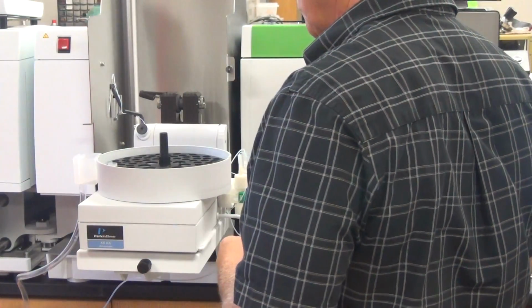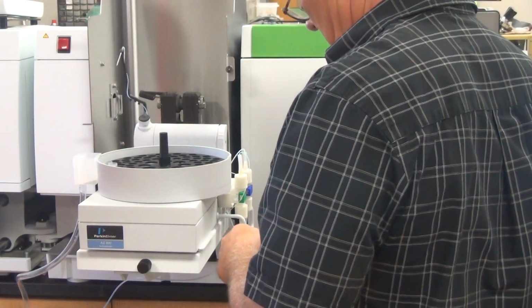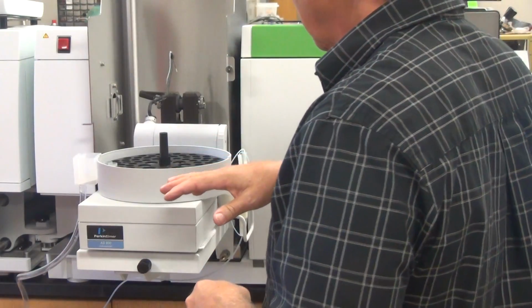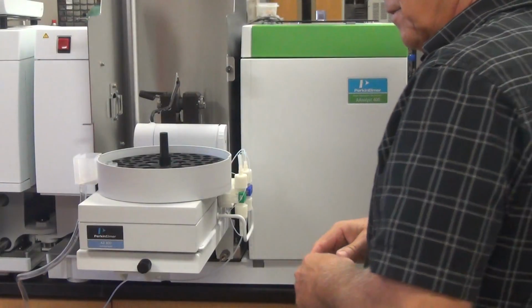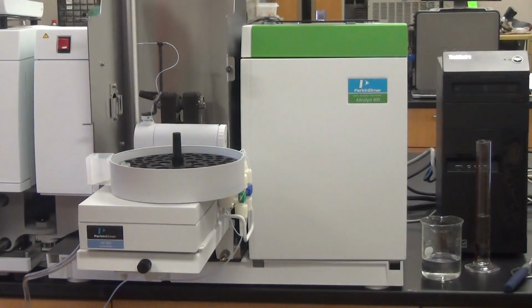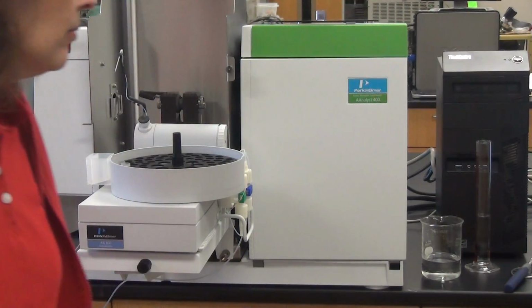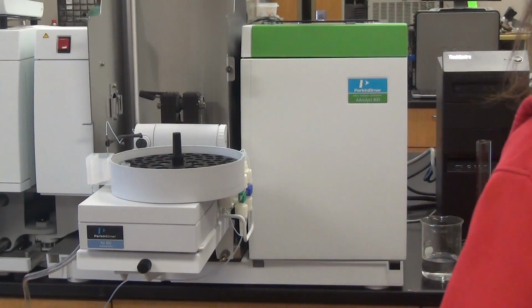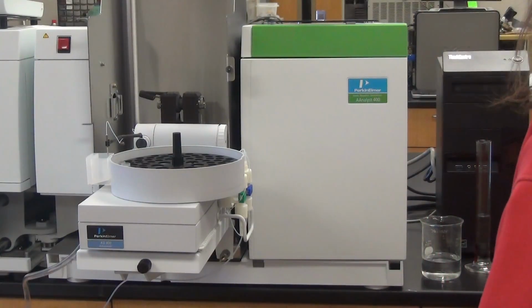Now, I was waiting for a cool down. Yeah, it's gonna be one more time. But see, it got it all ready, and it waited for it to hit the cool down. And then it did its baseline offset correction. Well, it's not really doing baseline offset there. It's looking at lamp intensity, making it stable. It's not an auto zero, because that's different.